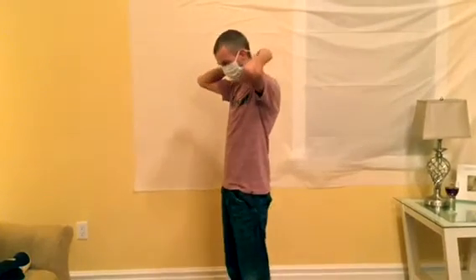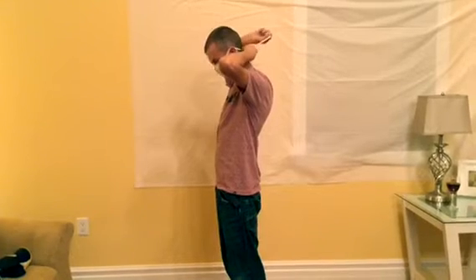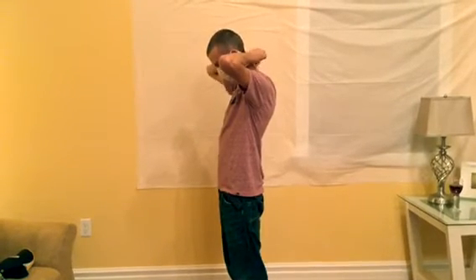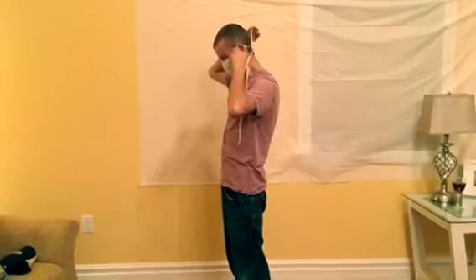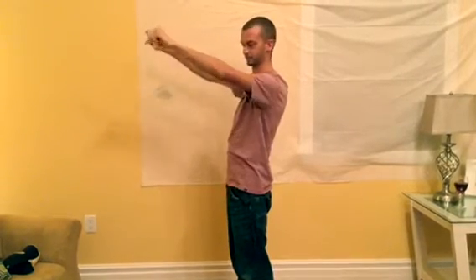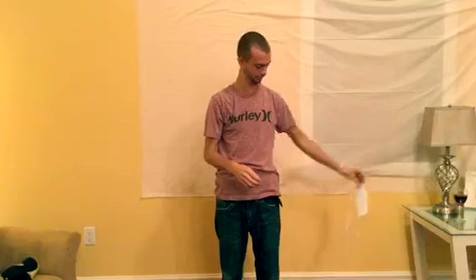To remove this mask, undo the knots and hold the mask by the two straps. While holding the mask by the straps, ensure that you do not touch the front of the mask. After the mask has been used, dispose of it in a waste bin.